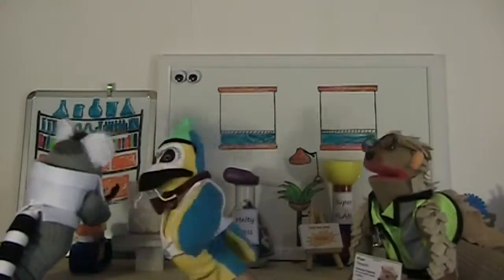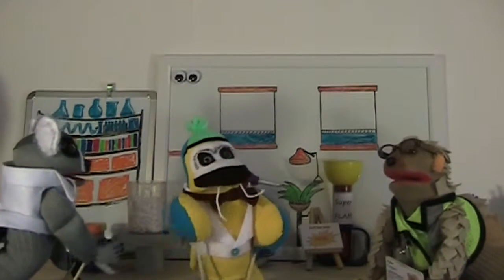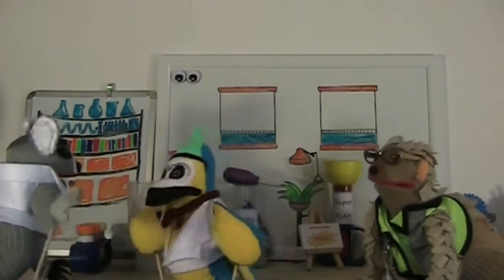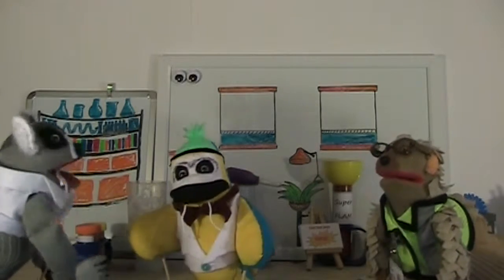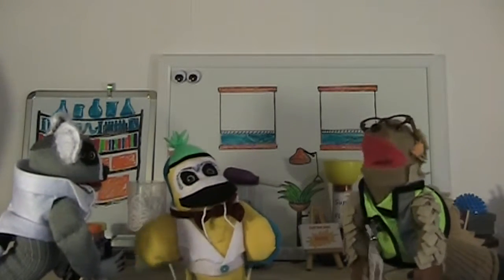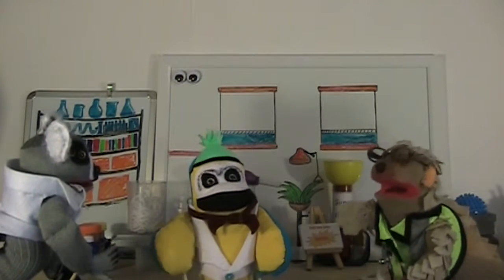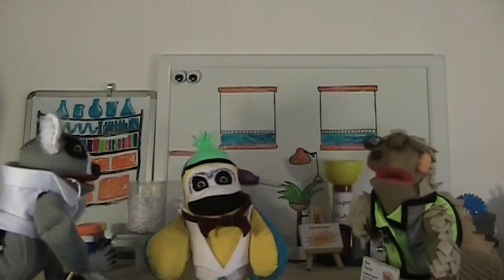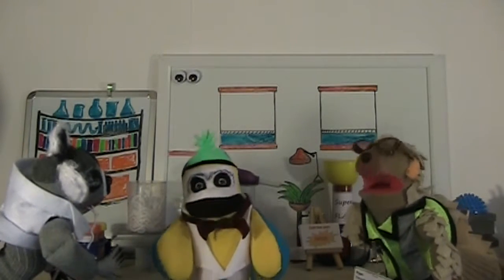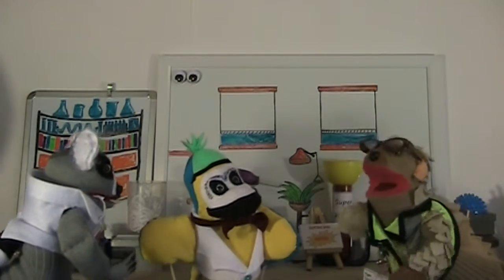Hello, I'm Piper. I'm the new industrial hygienist. Oh, hello, I'm Manny, the lab manager. This is Lemmy, our lab tech. What's an industrial hygienist? I'm here to make sure your lab is a healthy and safe place. And how do you know if a lab is healthy? Simple. We look at how you do your work, what you work with, and where you work. And then what? Well, we use science.